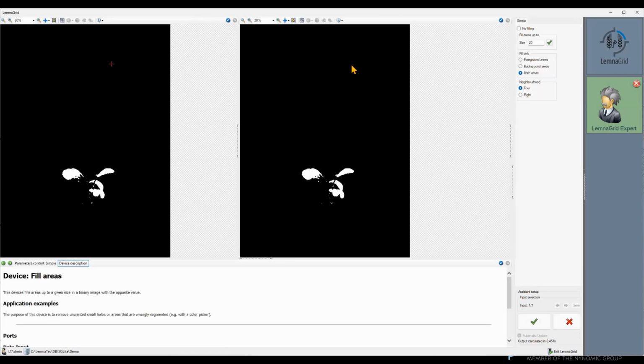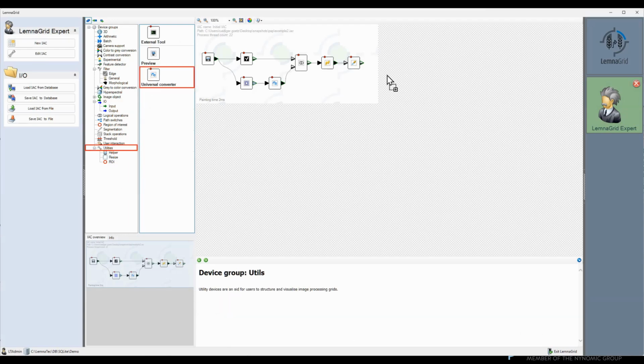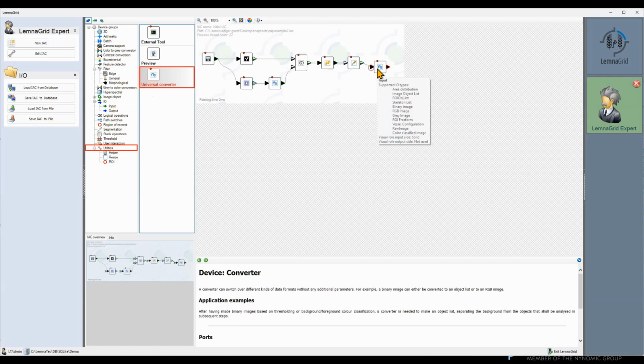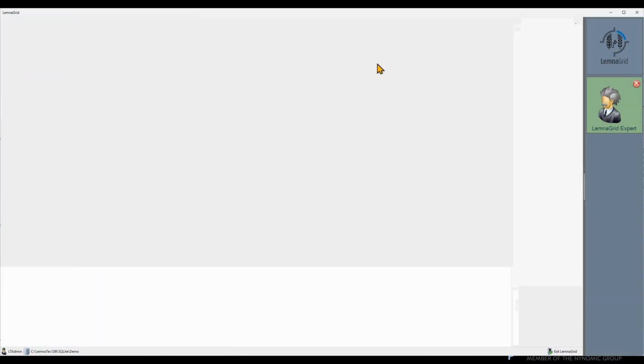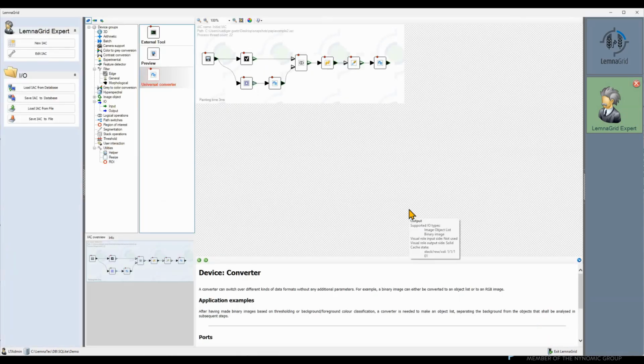As mentioned in the previous video, the default size of 20 is a bit small for modern high-resolution images. Let's try 200. This looks good. To finish the segmentation part, we need to convert this binary image into an object list using the universal converter. Even though image object list is pre-selected here, we need to open it once. But let's have another look at the object list in the universal converter.